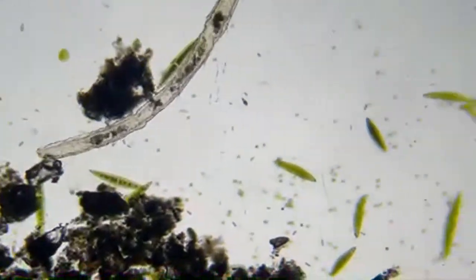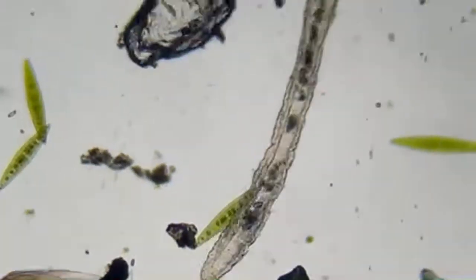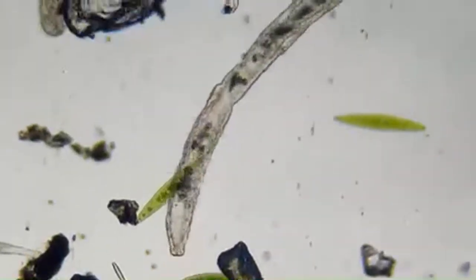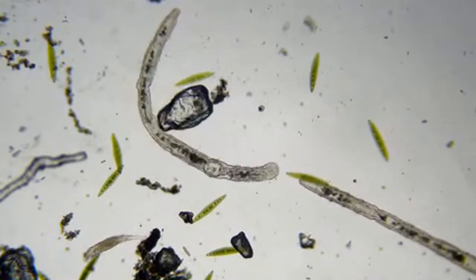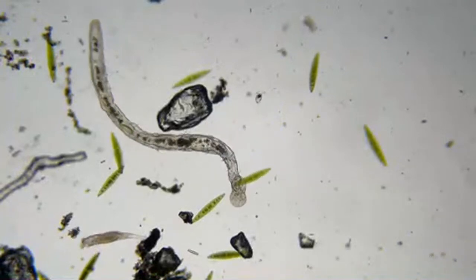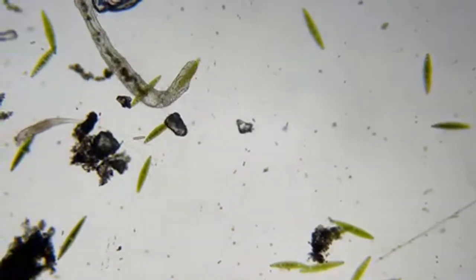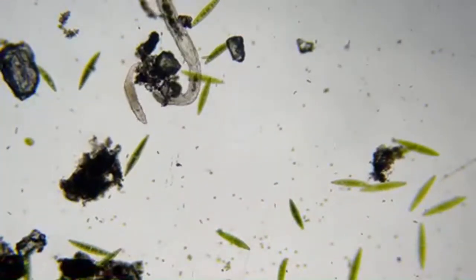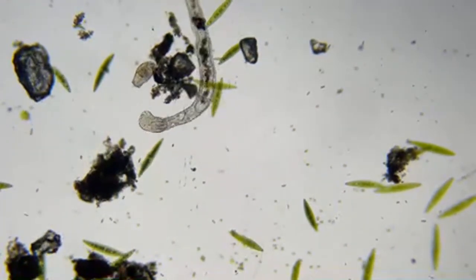And this guy started to divide. I can see. Notice behind him, he looks like he's got another head growing out of him right there. He's starting to divide off, or he already started, and pretty soon that from there back is going to be another worm, and it's going to eventually fall off. Oh, he's tangled up in some Closterium. Looks like he's aggravated. That's funny. Get this weed off of me. Vile weed. Oh, they got rid of it. Sometimes this stuff can get funny if you're really into it.